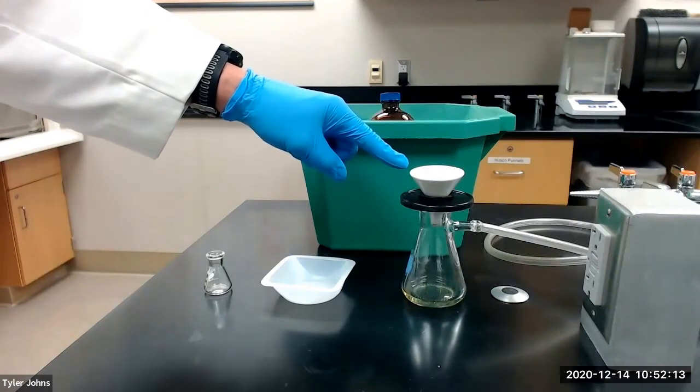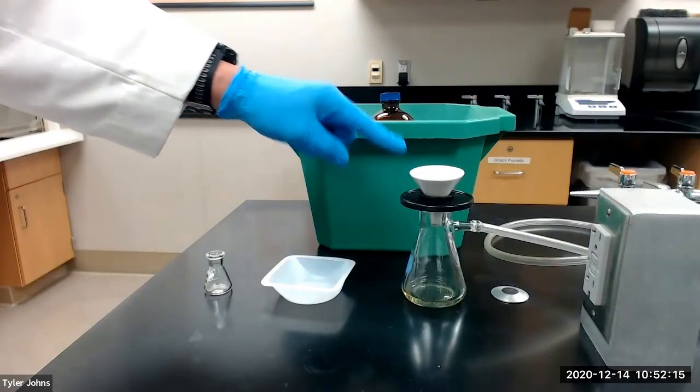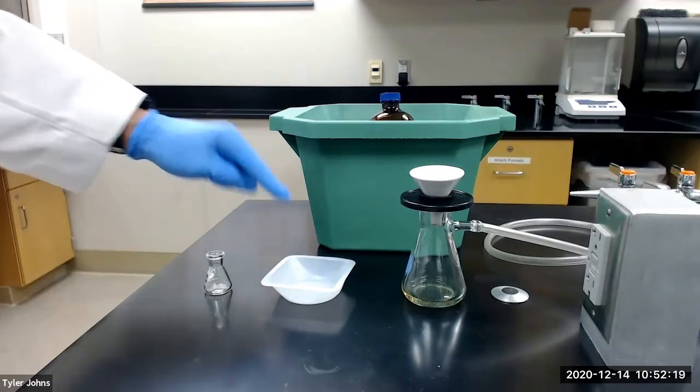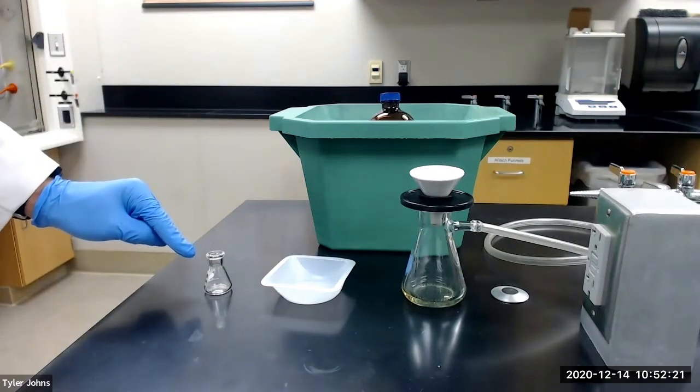After collecting and washing the crystals, we will next transfer the crystals to a weigh boat, which we will use to aid us in transferring the crystals to a new 10 milliliter Erlenmeyer flask.